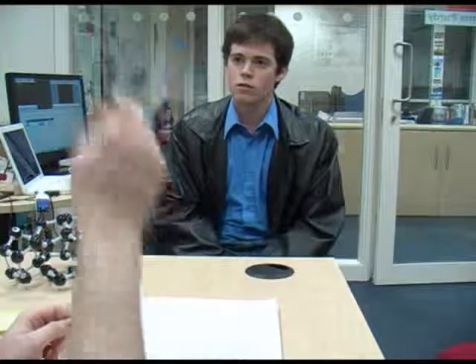Now, as I'm sure you know, we ask all our potential employees here to undergo a 3-day lab testing session, as it were. Just to sort of understand your general lab practice and see how well you've done at it. And I do have the results back for you here. And I'm afraid there's a few things that we need to discuss. If I could just draw your attention to the video screen behind me. We were filming you whilst you were in the labs, and there's just a couple of things that I'd like to show you.